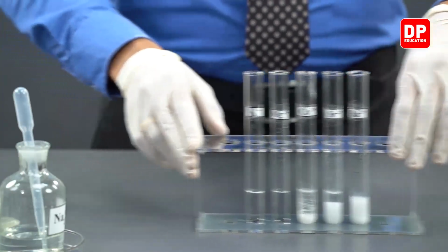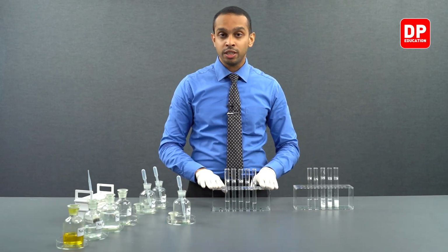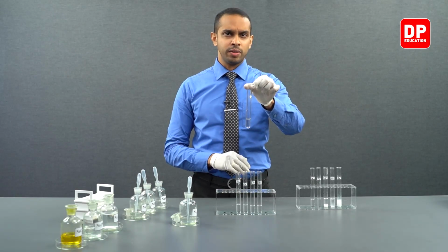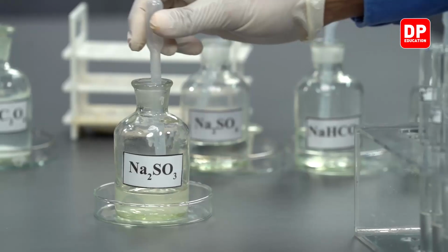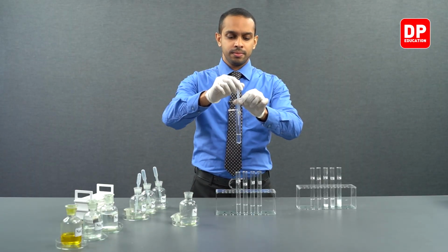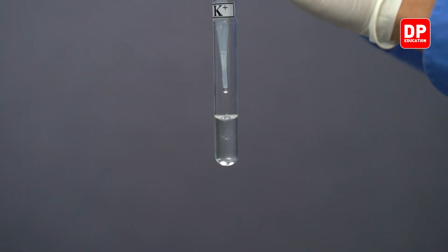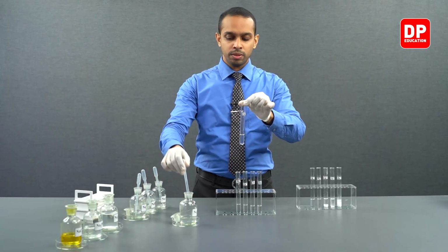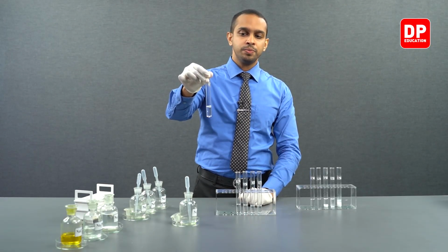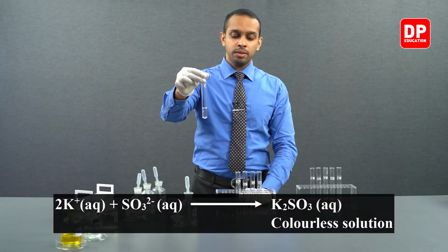We'll keep this aside for the time being, and we'll take a new set of samples of each of the cations. Let's take our potassium 1 plus aqueous ion solution and add a small amount of sodium sulfite. Sulfite ions will be introduced by the addition of sodium sulfite into the potassium aqueous ion solution. Now you can see what happens upon the addition of sodium sulfite.